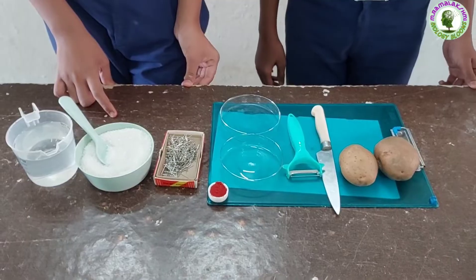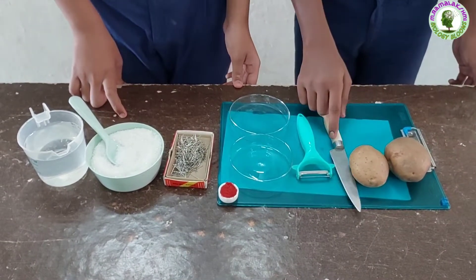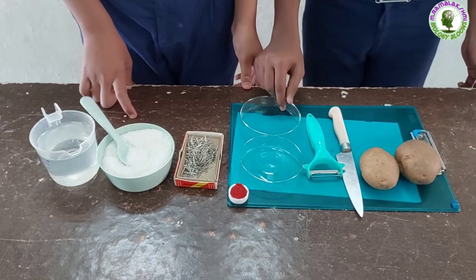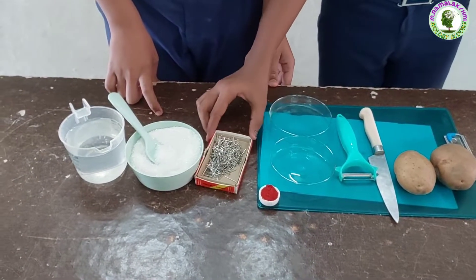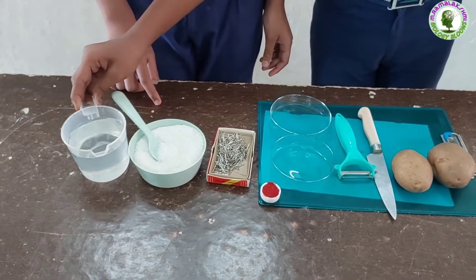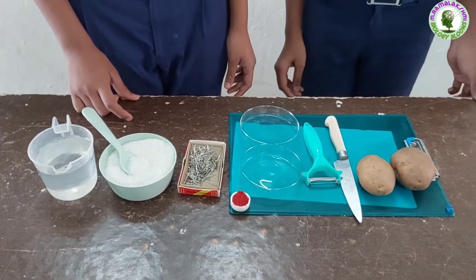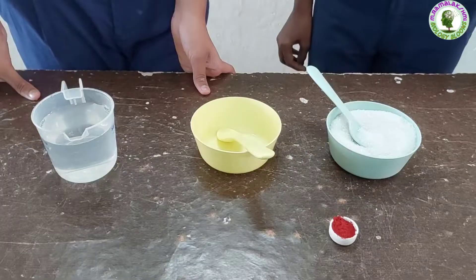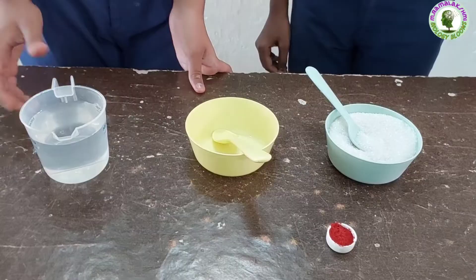To do this activity, we need two potatoes, a knife, a peeler, two petri dishes, food color, needles, sugar, and water. First, we have to prepare a saturated sugar solution. Children, prepare a saturated sugar solution.